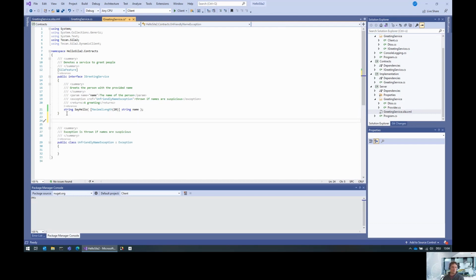There are already list implementations, but for a custom data type, you basically have to create this custom data type first. So what I'll do is create a person class or structure, and that consists of a name and a gender.